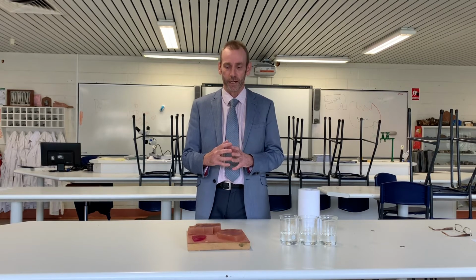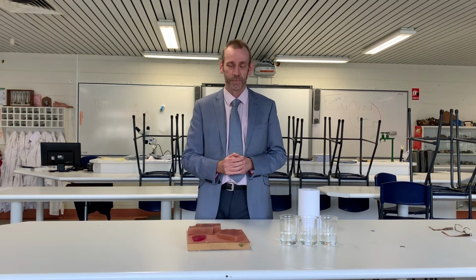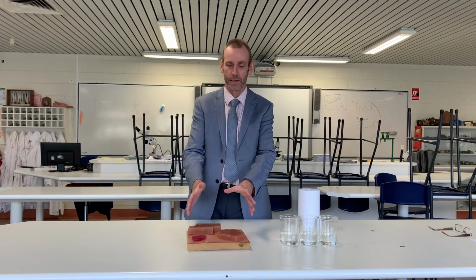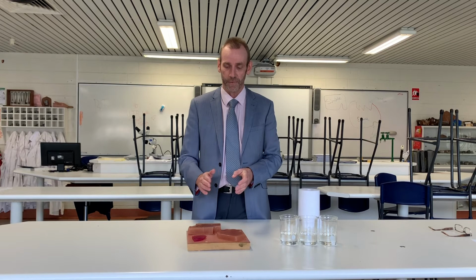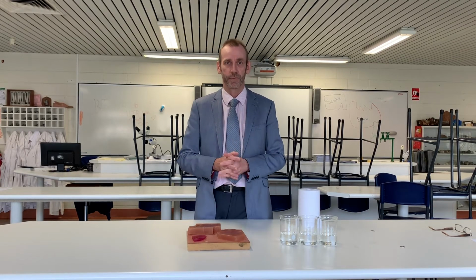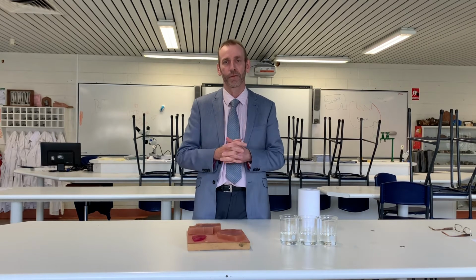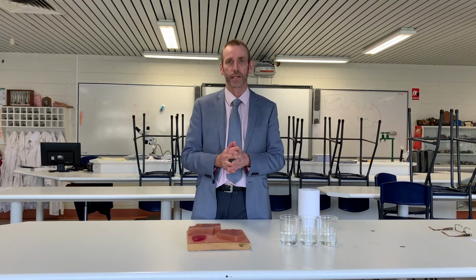And we're going to do that using some agar gel, which is infused with phenolphthalein, which is a pinkish colour when it's alkaline, so this has got a slight alkaline consistency to it. And we're going to look at vinegar passing into these agar blocks, cut to cubes of different sizes, and just seeing how the vinegar diffuses into cubes of different sizes and how we relate this to surface area to volume ratios.